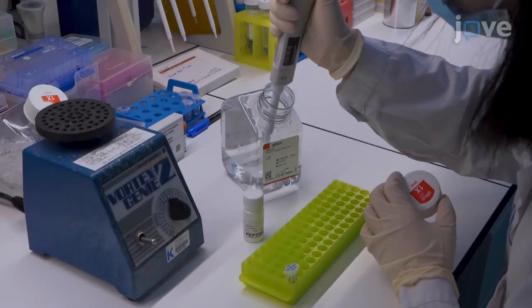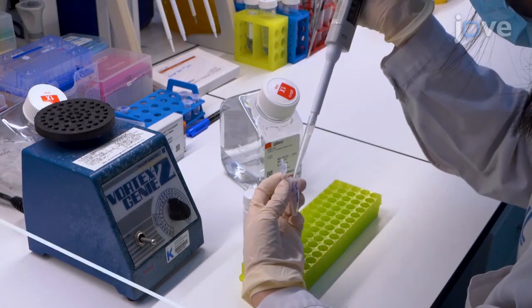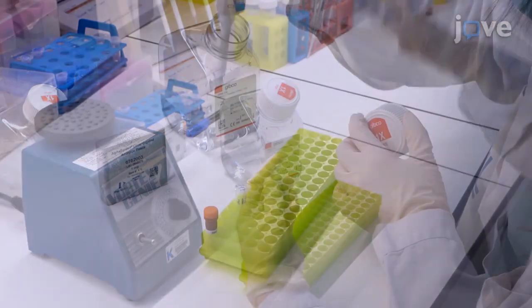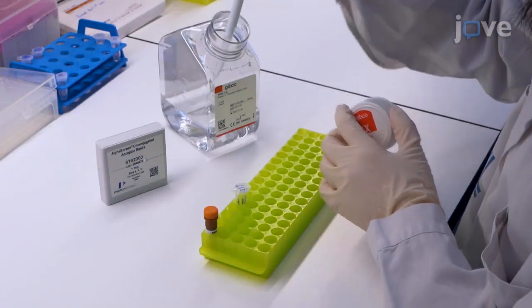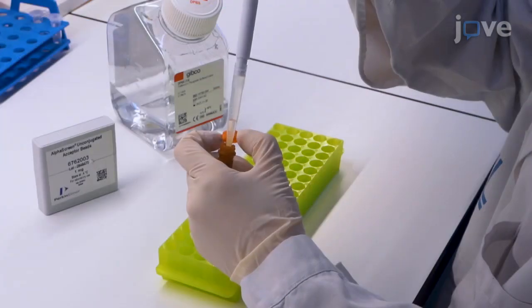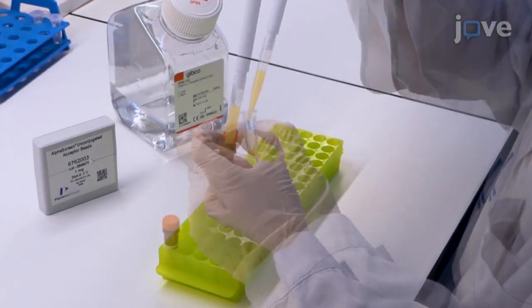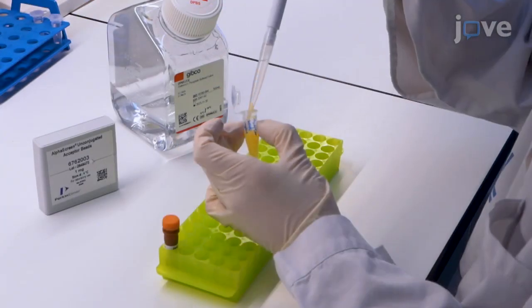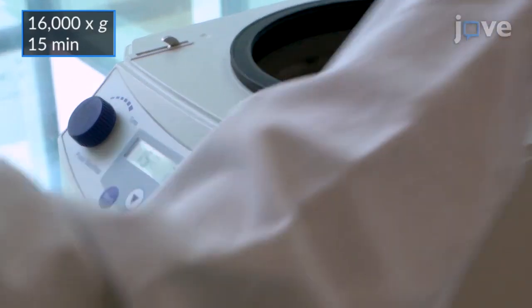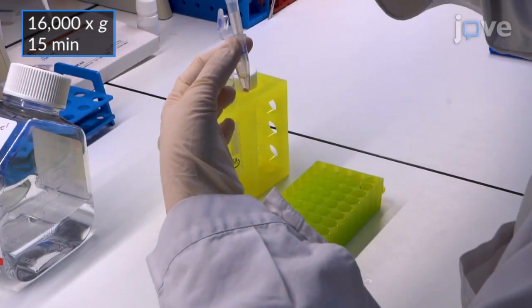Begin by diluting the Hsp90 peptide in PBS at 1 mg per mL concentration. Dilute the unconjugated acceptor beads in PBS and transfer the beads into a 1.5 mL tube. Centrifuge the diluted beads for washing, and then carefully remove the supernatant.